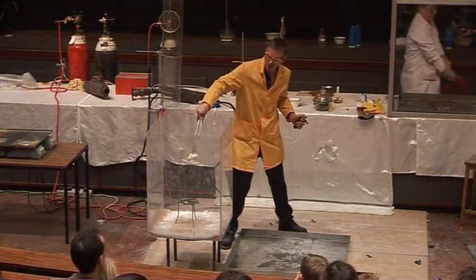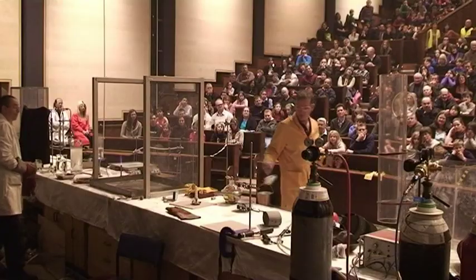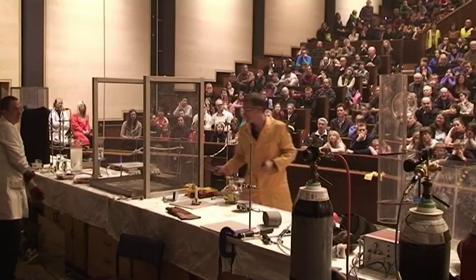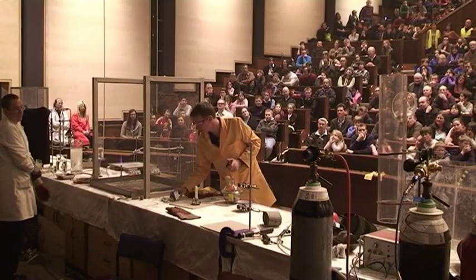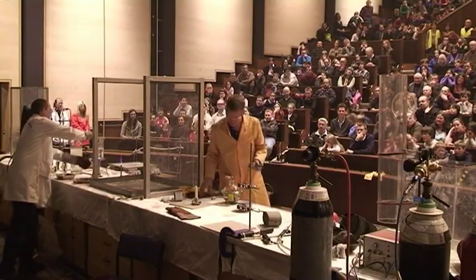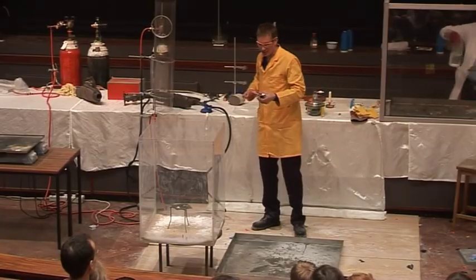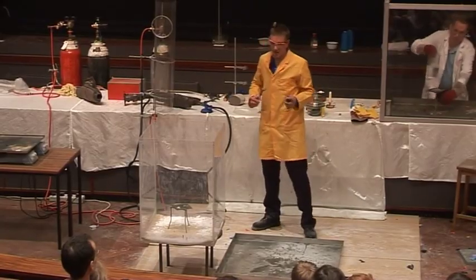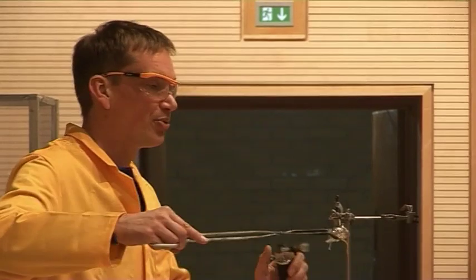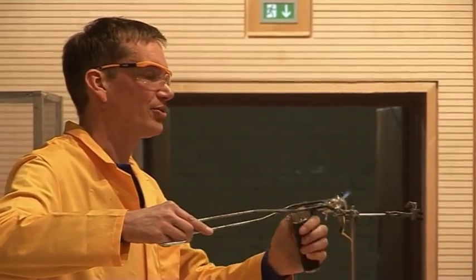Could this be used to put out burning magnesium? Well, let's try it. So I have some magnesium here, and I'm going to set this on fire and see if we can put this out in the carbon dioxide.